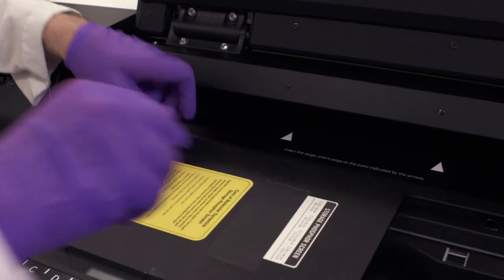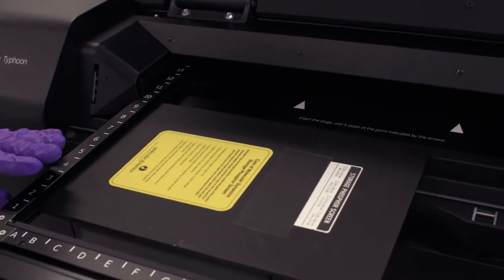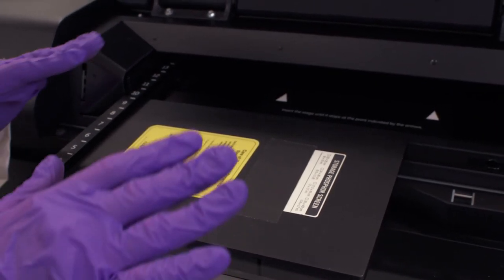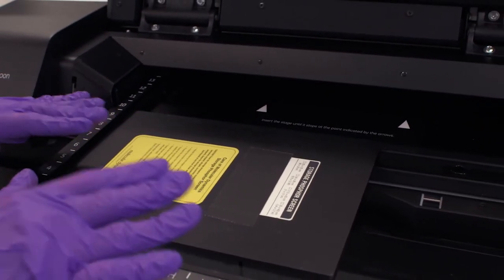So we'll carefully place this in here. We'll take note of the dimensions 2 to 10, A to L, and remember we need the white surface facing downwards towards the lasers.